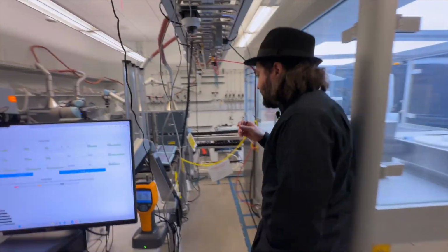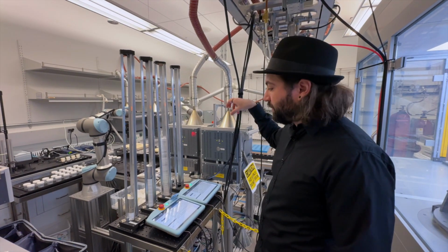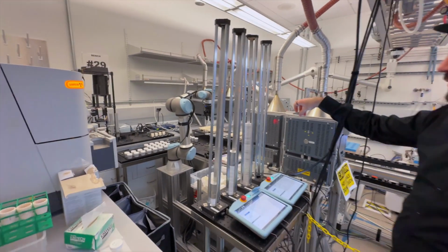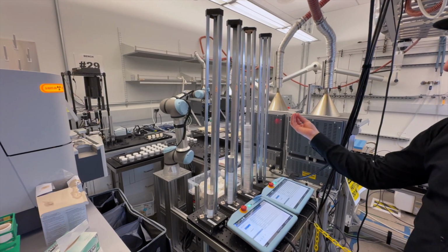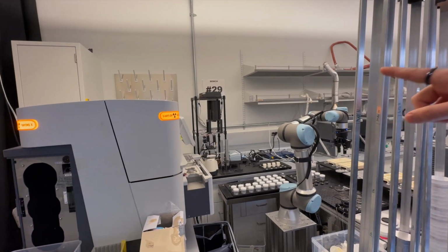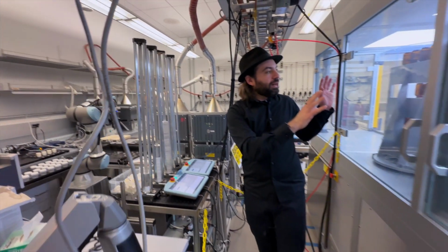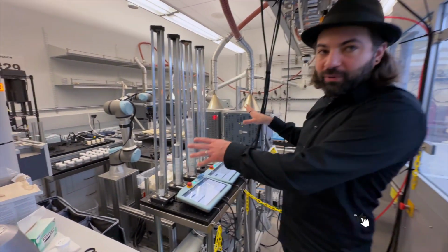And then here in this station, after they are baked, they go back to the trays there. And then this robot arm here is going to take the crucible and bring it to the ball dispenser, which is right there, the tower. As you can see, a lot of 3D printed parts. This lab here, the powder station, was designed by a company upon our request. But this side here is us, we made this part.